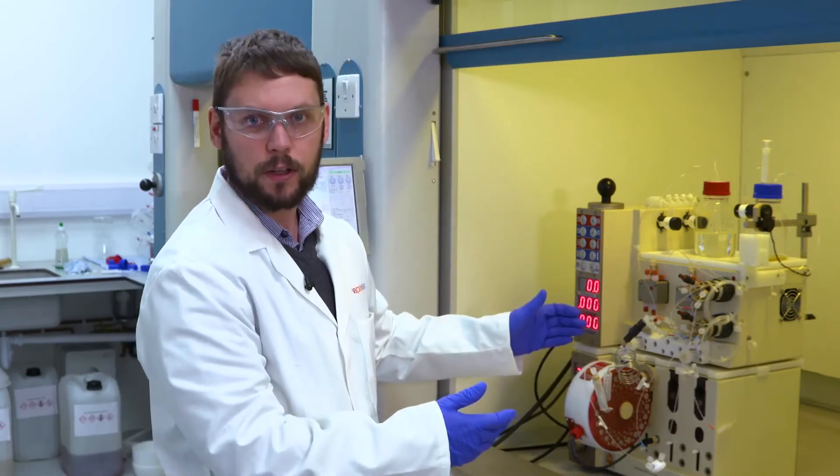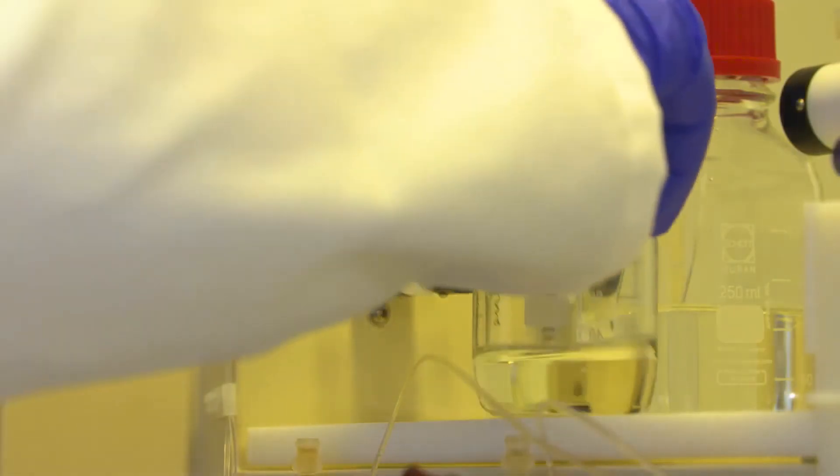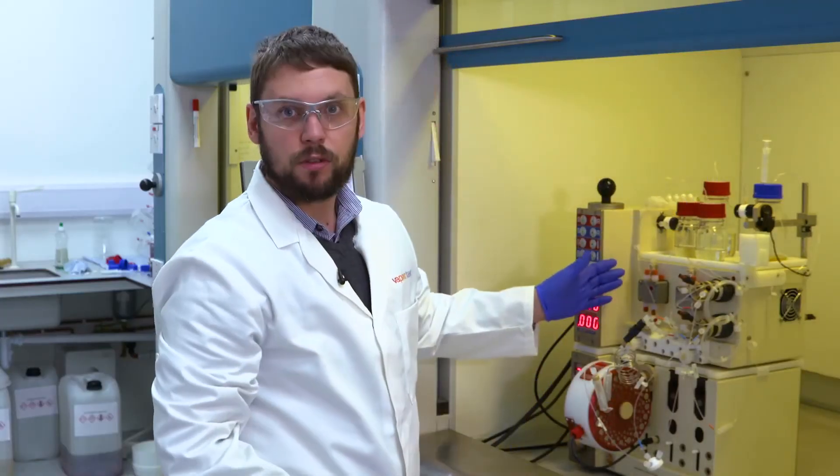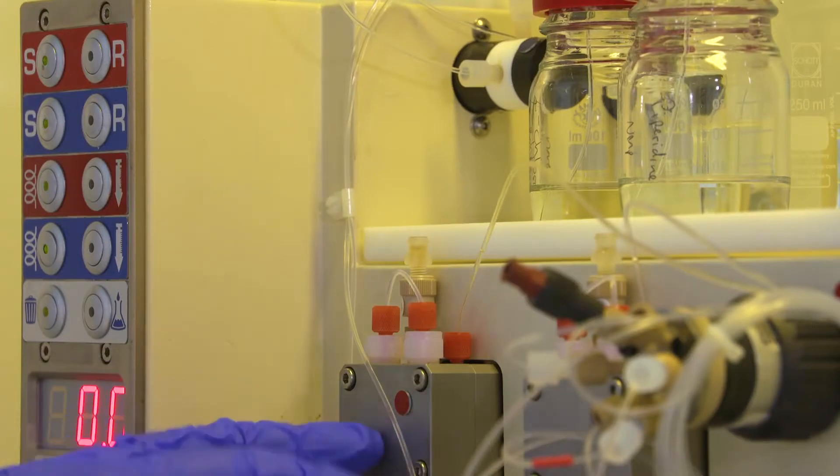Now that the reactor's on the system and all the tubing is connected I can load my reagents. Now the reagents are in place I need to prime the reagent pumps. So the last thing to do before we start is fill the backwash of the pumps.